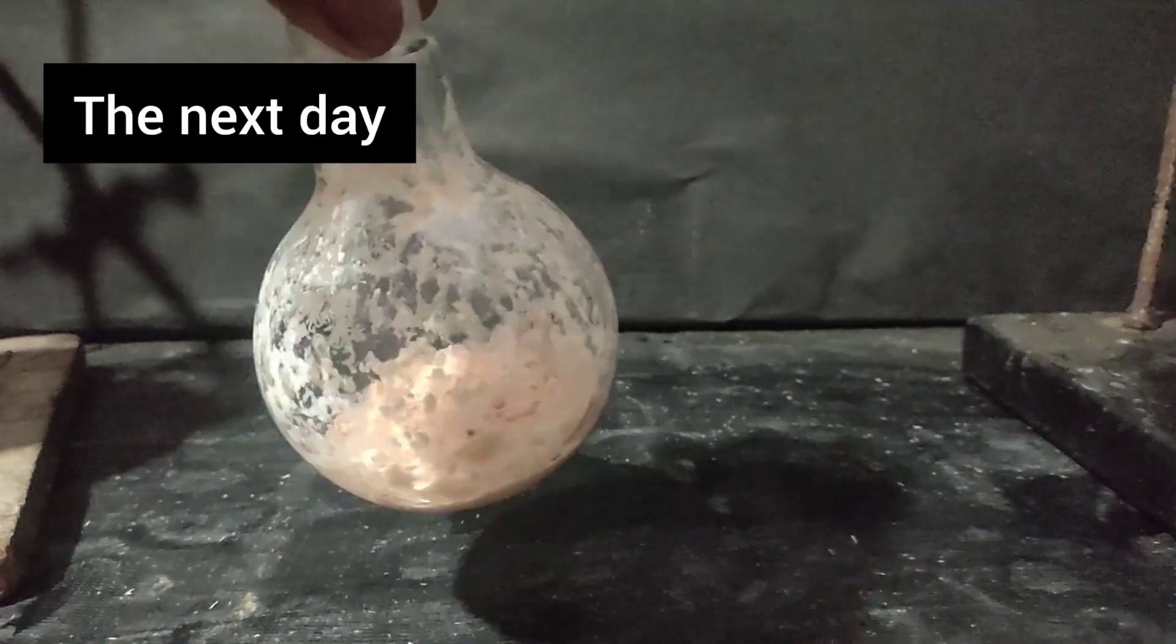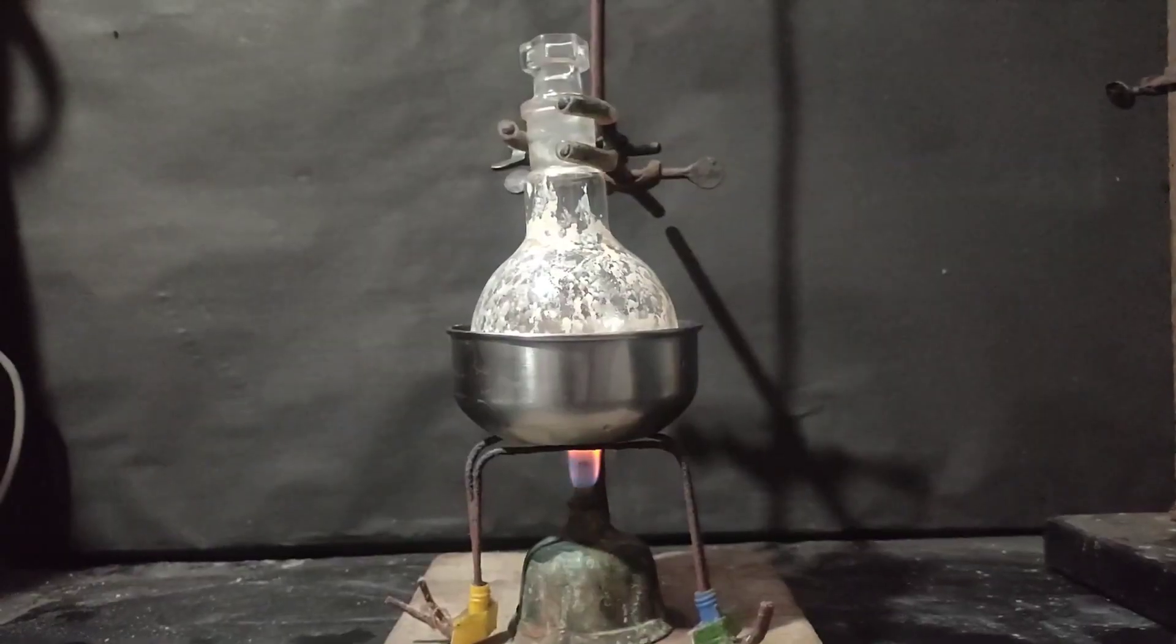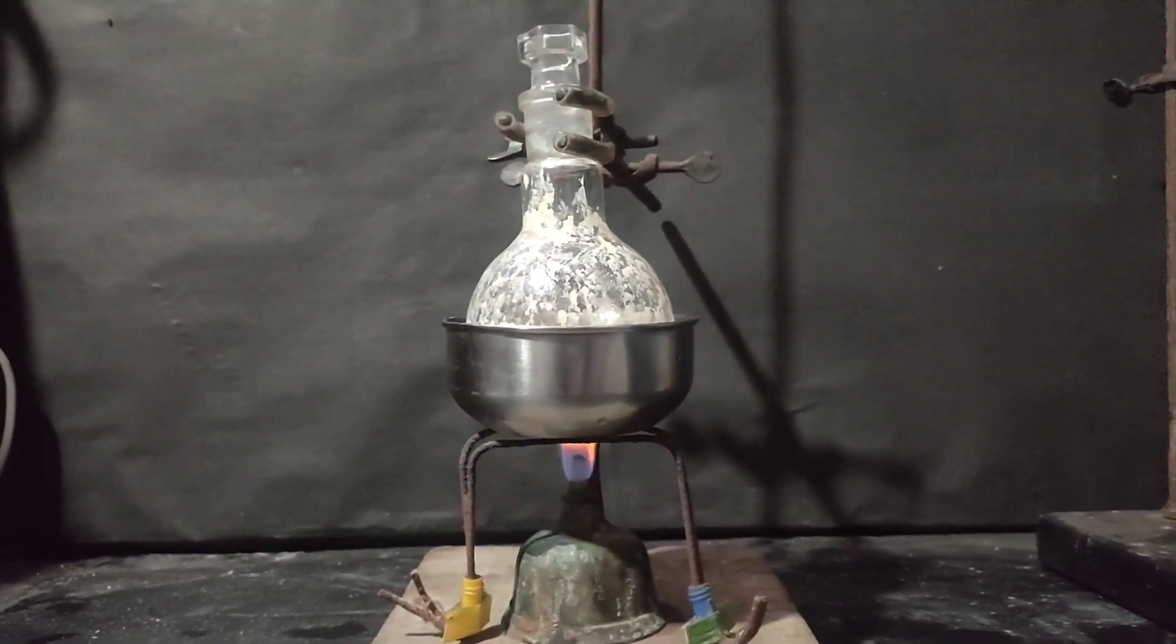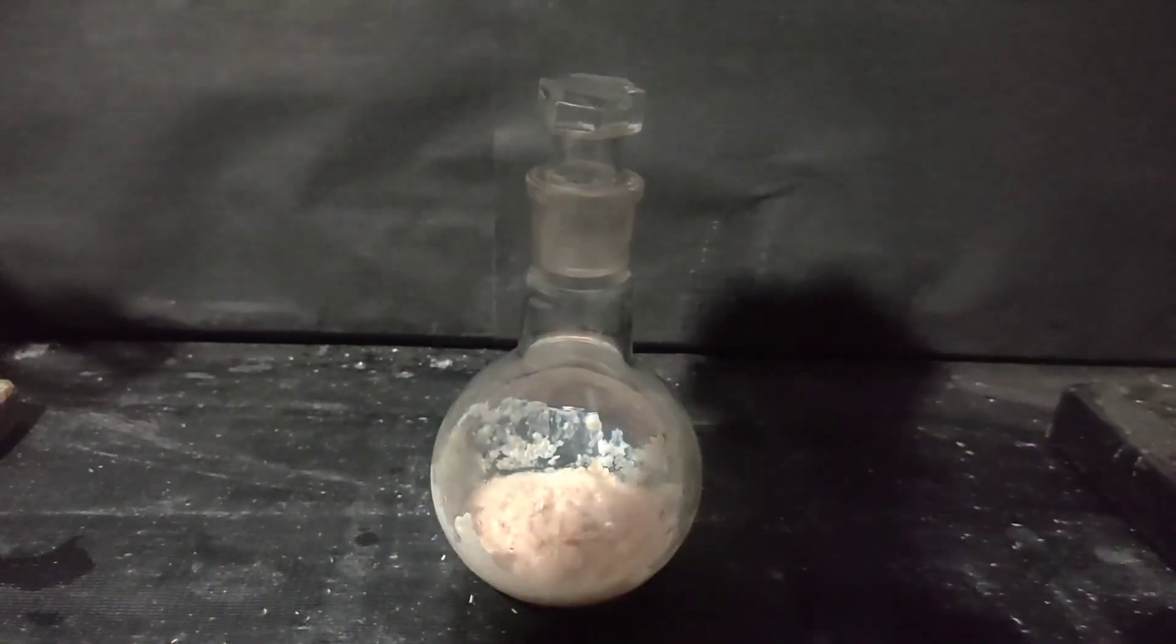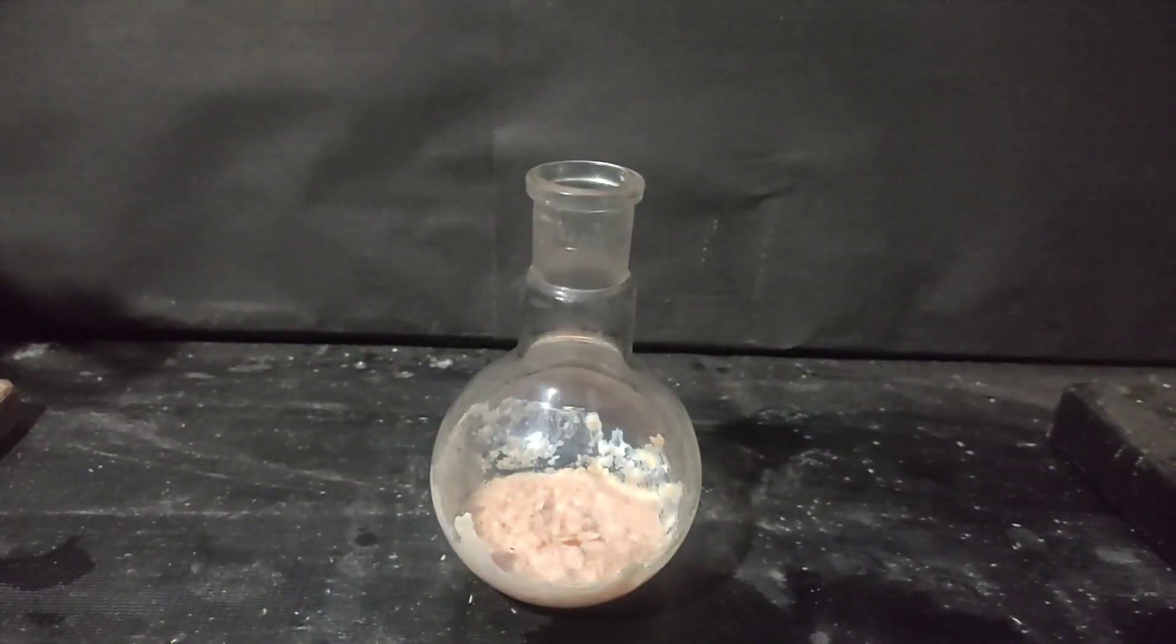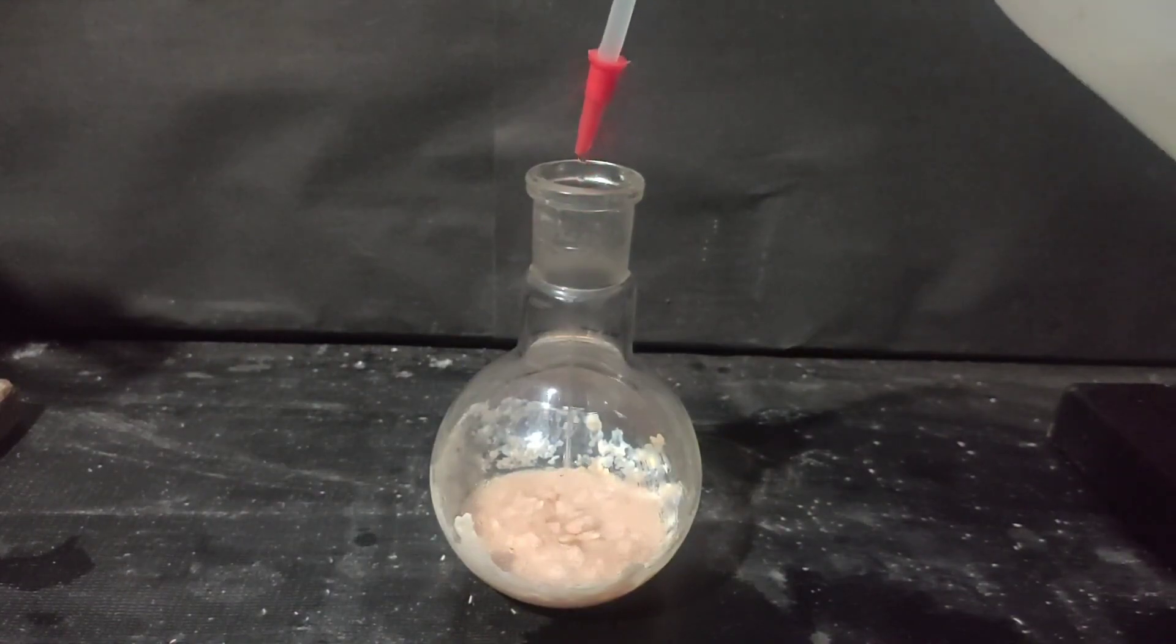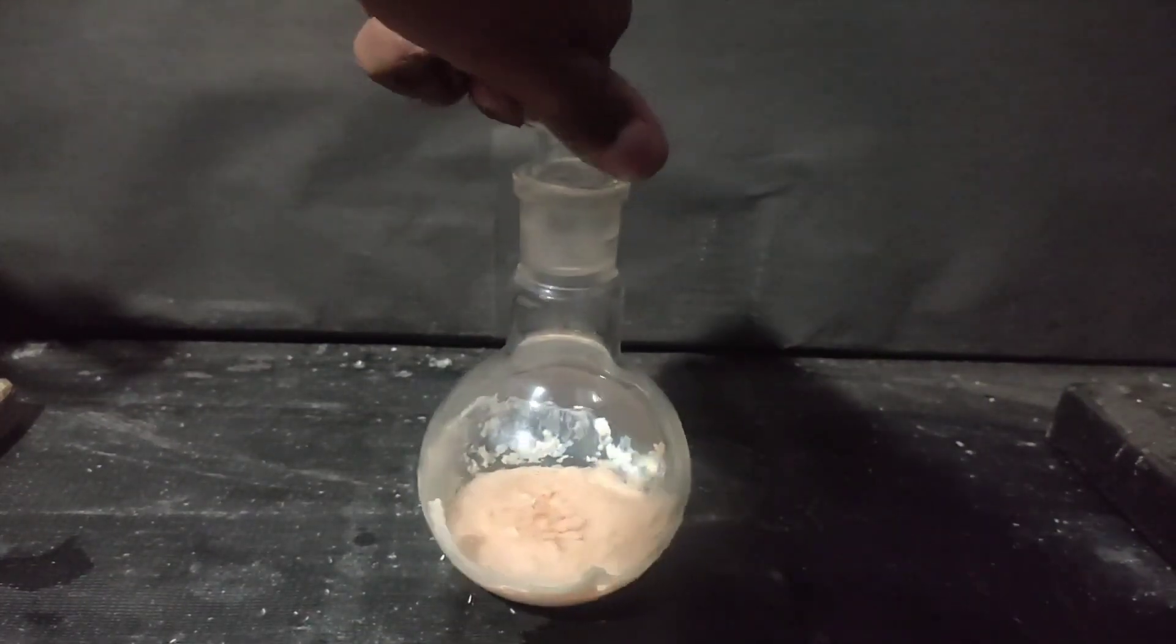The next day the solid has turned pink. I opened the flask and smelled it. It still had the smell of benzaldehyde. So to complete the reaction I kept the flask on a hot water bath for around 30 to 40 minutes. When the flask cooled I again opened it and smelled it. Now the smell of benzaldehyde was not observable and a pleasant smell of benzyl alcohol was observed. So I added distilled water to dissolve the solid in small proportions.